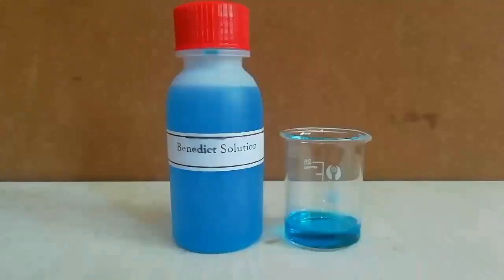Here is the Benedict reagent that can be used to identify glucose.